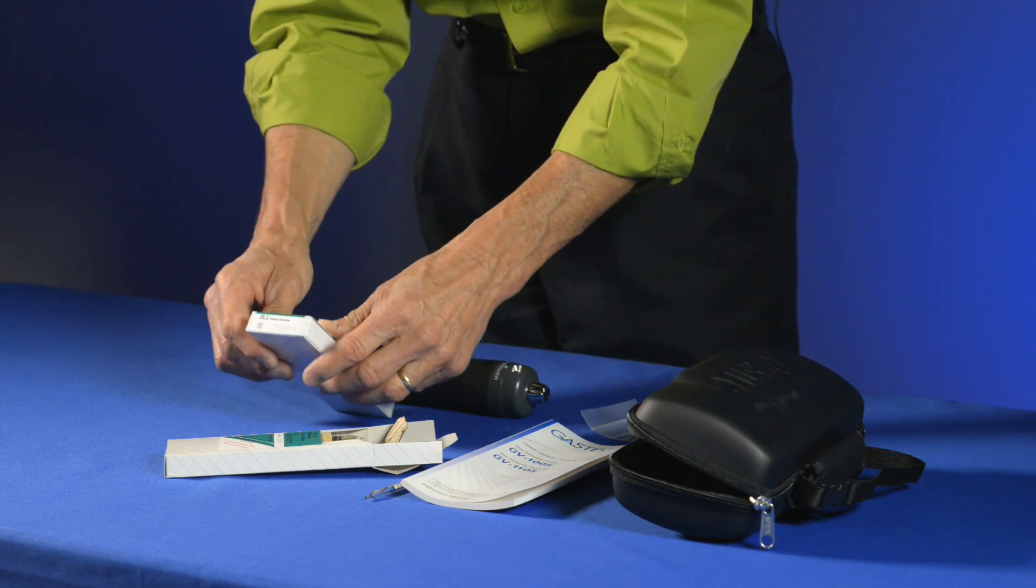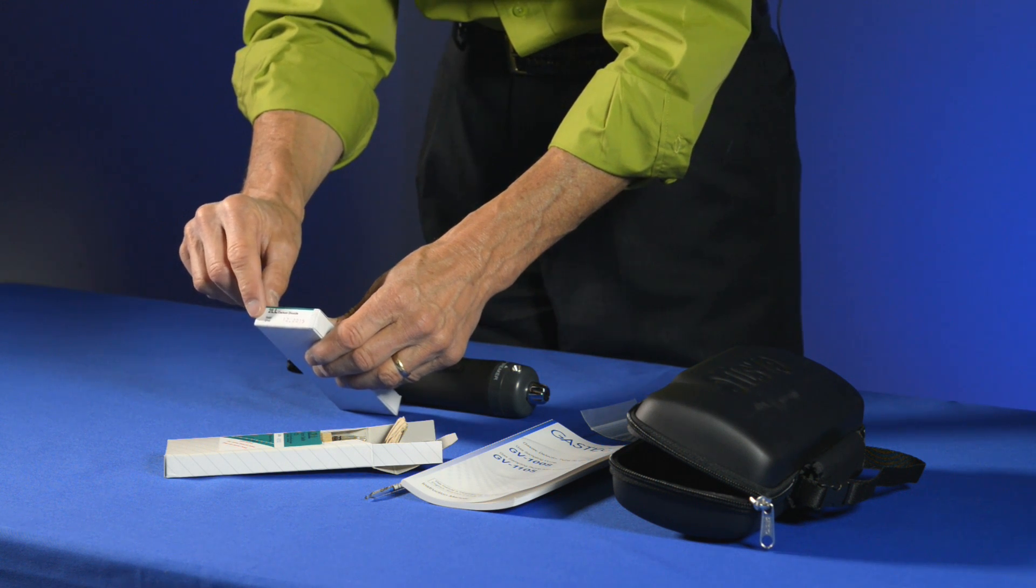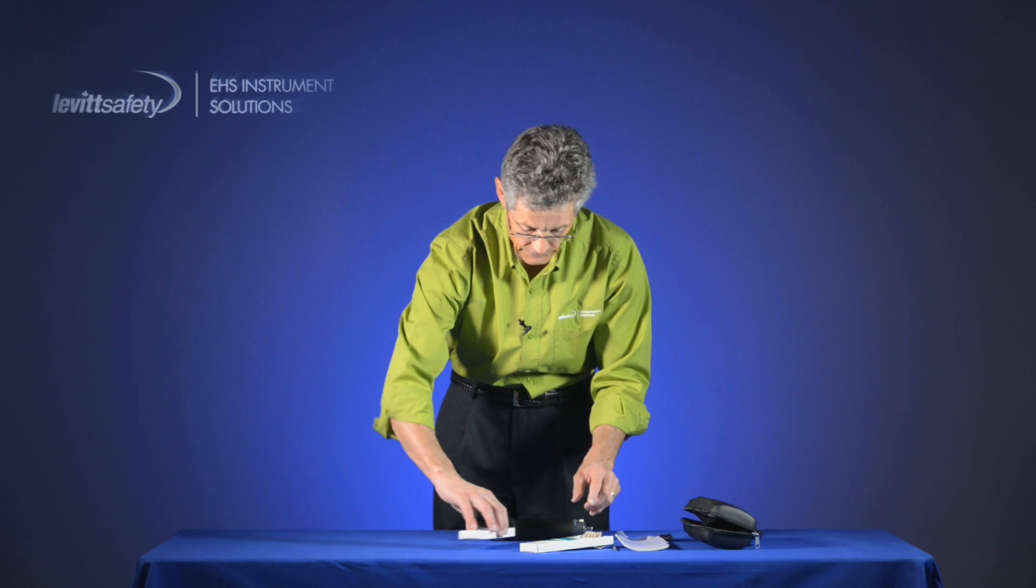And on the top of the box, you'll see the actual valid until date. And that's important to realize as well.